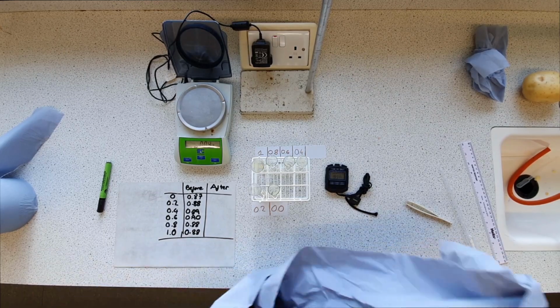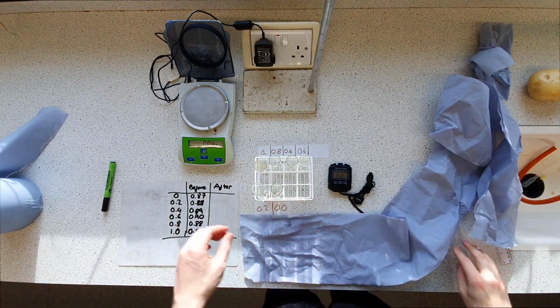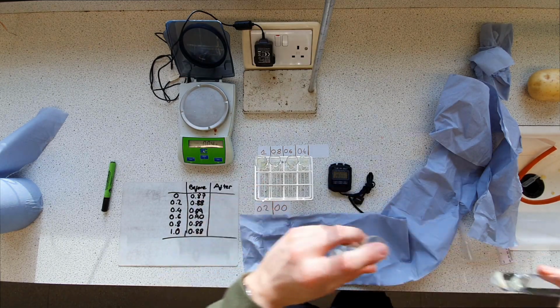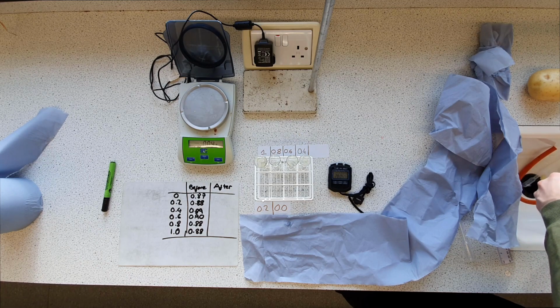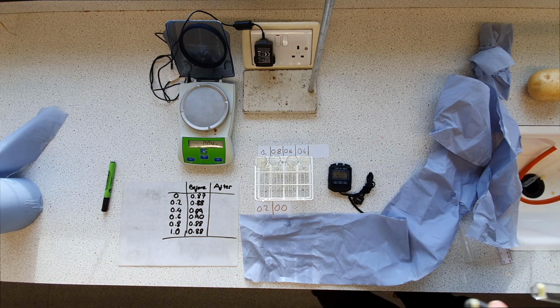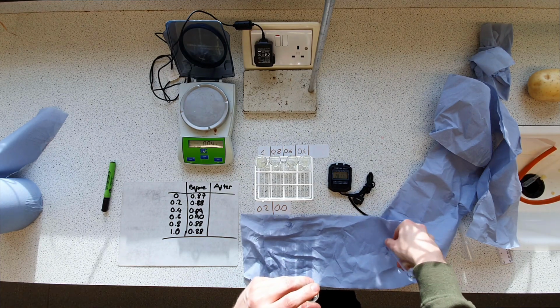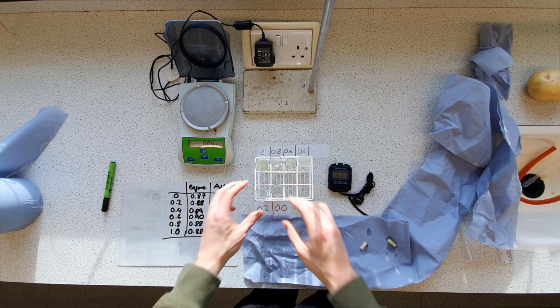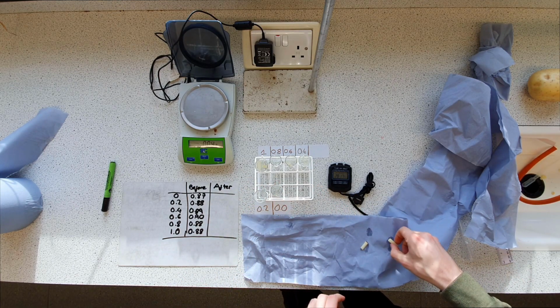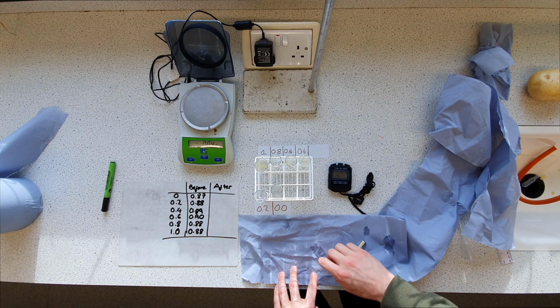Okay, we're coming to the end of our time. 1955. Right. Okay, 20 minutes. I'm just going to pour away the solutions while retaining the cores. Right, so those two. So we've got 0 on the right. 0.2 there. So we're just going to blot them dry again to make sure there's no excess moisture.